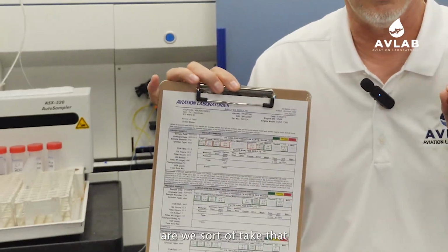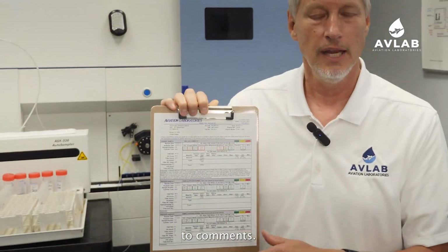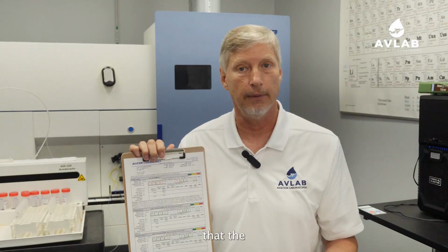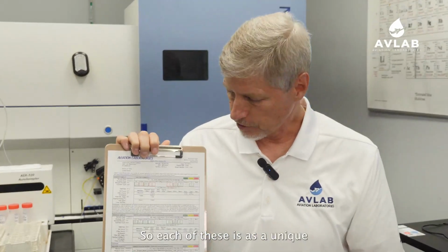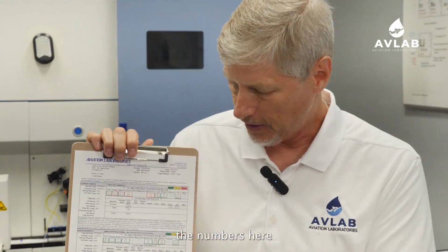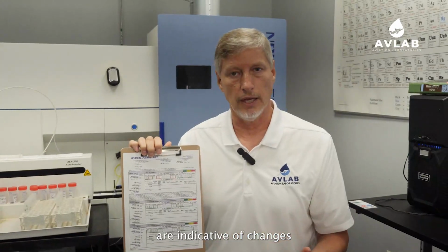We sort of take a "just the facts, ma'am," Dragnet approach to comments. What that means is we give you just the facts in the way that the engine manufacturer would like to have them, so that you can just show them this report and it contains all of the information that they require. So each of these is a unique analysis.